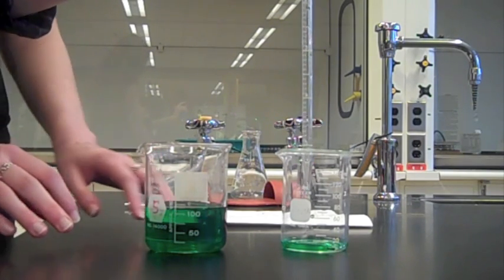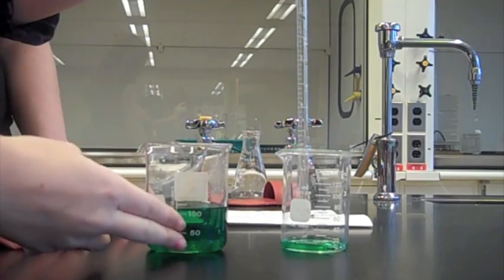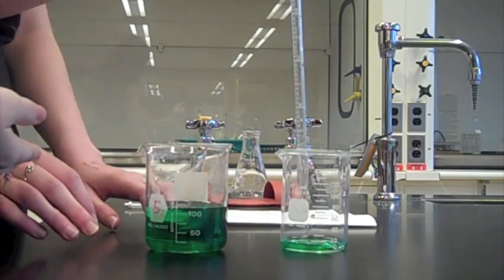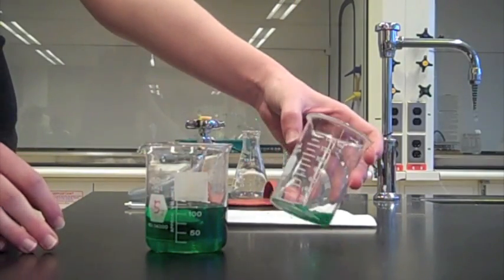And now five milliliters has been transferred from this beaker to this beaker, solving your problem. All my chemistry problems are solved.